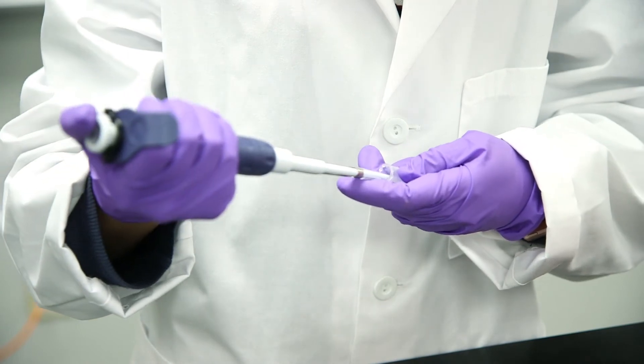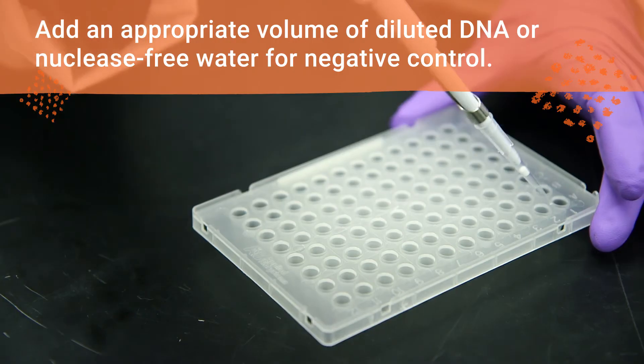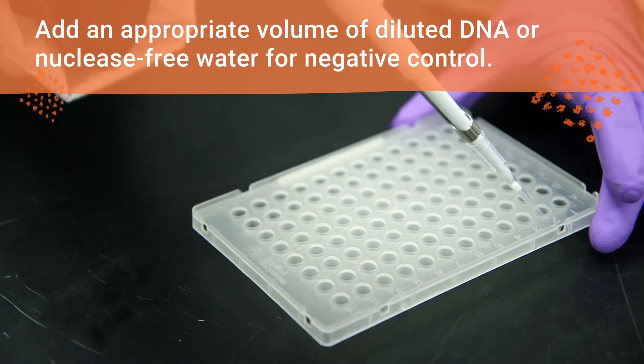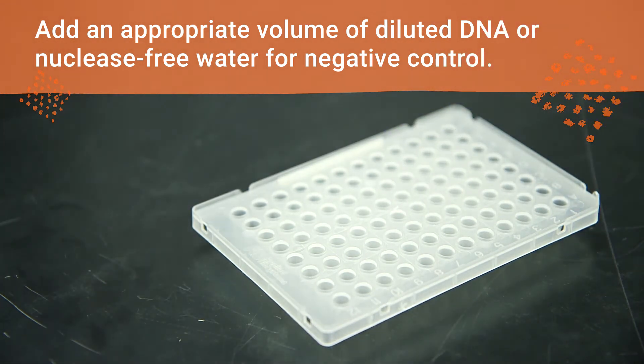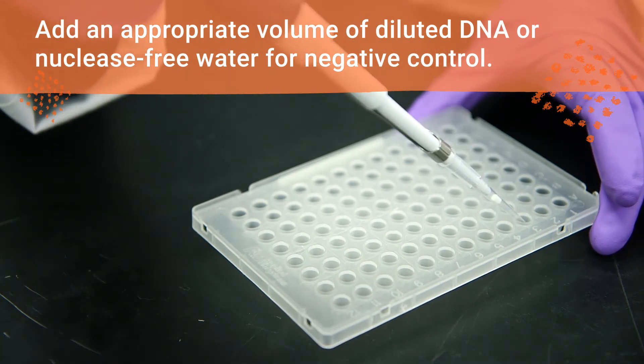Begin by preparing the appropriate dilutions of your DNA in nuclease-free water. Add an appropriate volume of diluted DNA or nuclease-free water for negative control to all of the appropriate wells of your reaction plate.